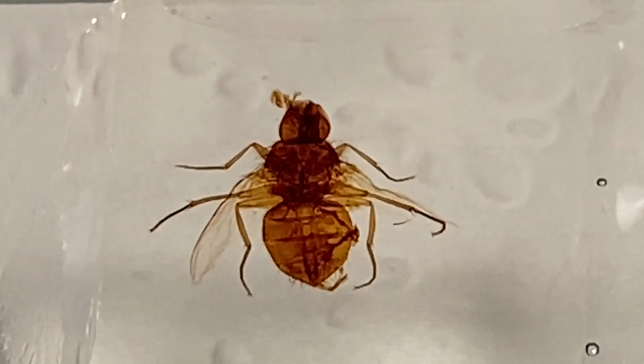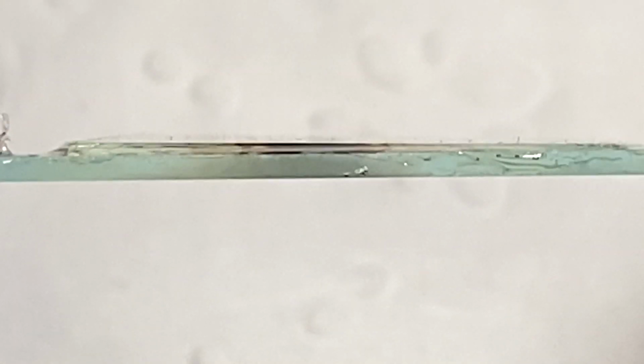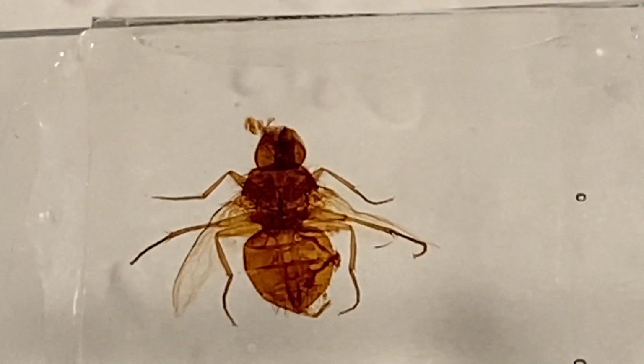But anyway, we have here a housefly that was processed some time ago and made into a whole mount. You can see that's a pretty thick housefly. I didn't want to crush it too much because the structures may look damaged and crushed. So we wanted to maintain the integrity of the limbs, like round instead of squished flat. But it's flat enough for you to use a 20 power objective to zone in on the structures.